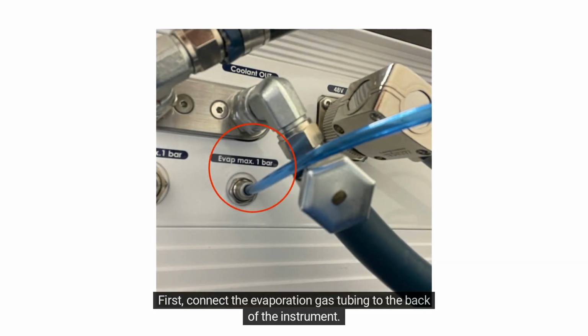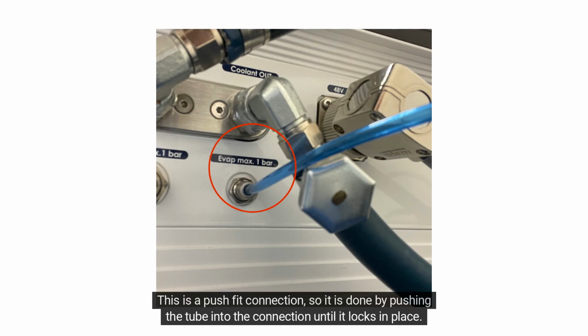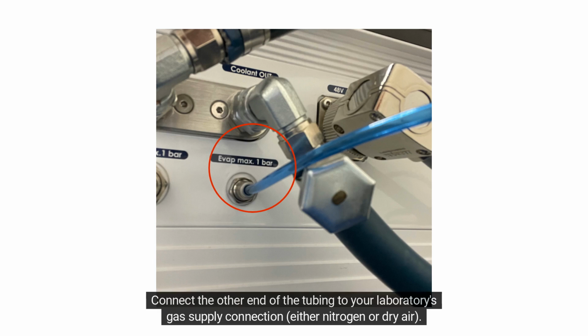First, connect the evaporation gas tubing to the back of the instrument. This is a push-fit connection, so it is done by pushing the tube into the connection until it locks in place. Connect the other end of the tubing to your laboratory's gas supply connection, either nitrogen or dry air.